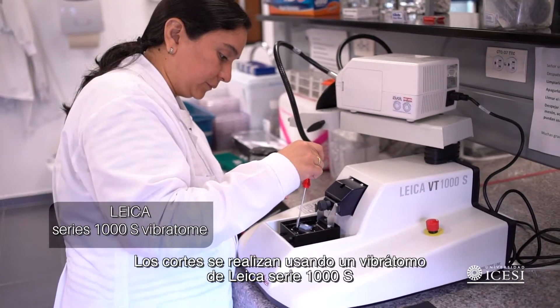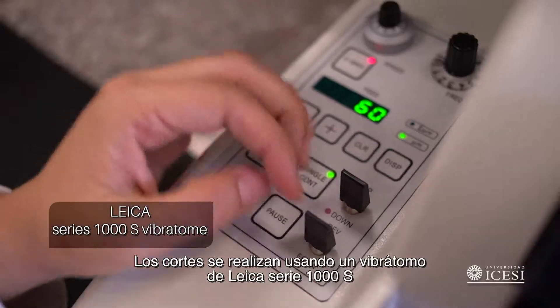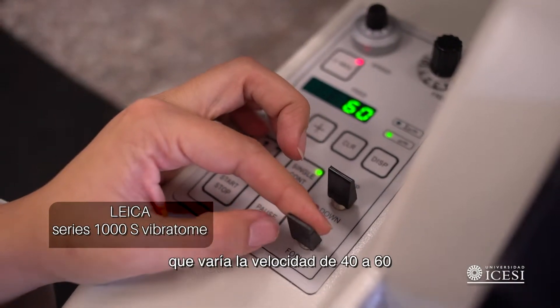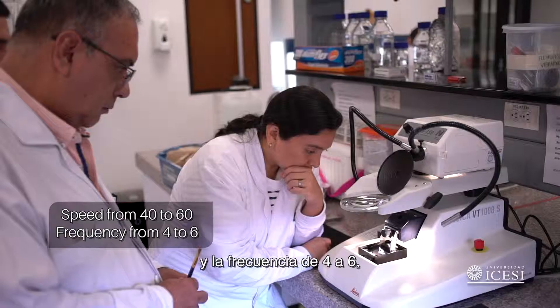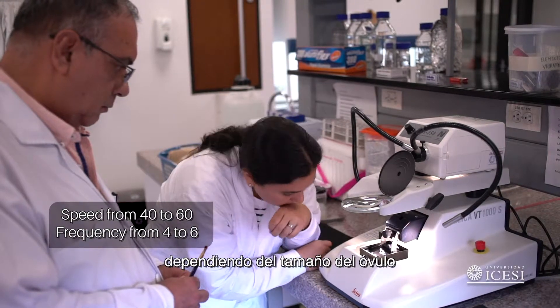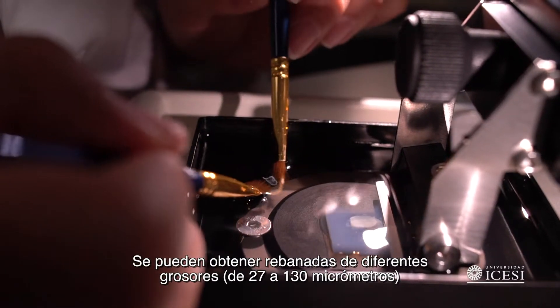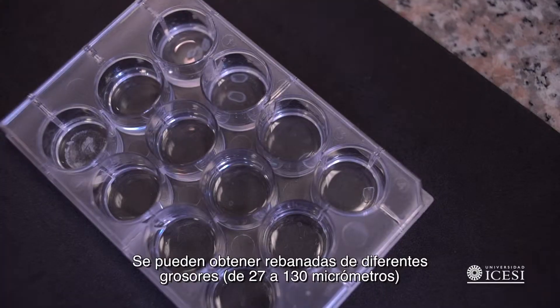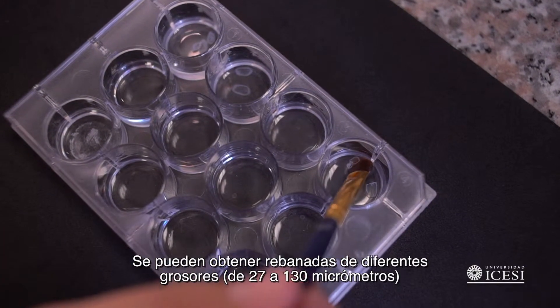Cuts are made using a Leica series 1000S vibratome, varying the speed from 40 to 60 and the frequency from 4 to 6, depending on the size of the ovule. Slices of various thicknesses from 27 to 130 micrometers can be obtained.